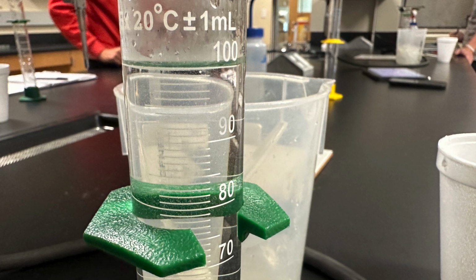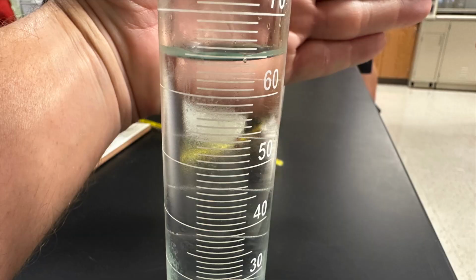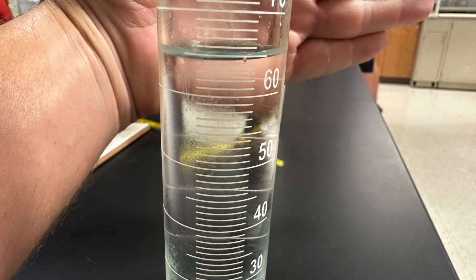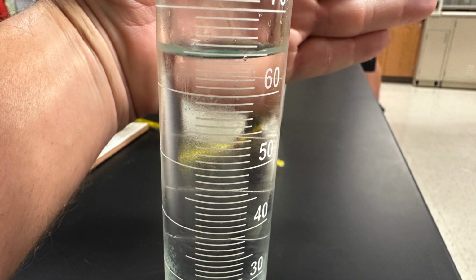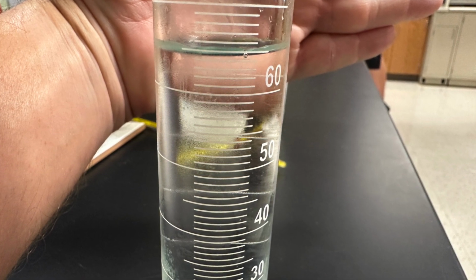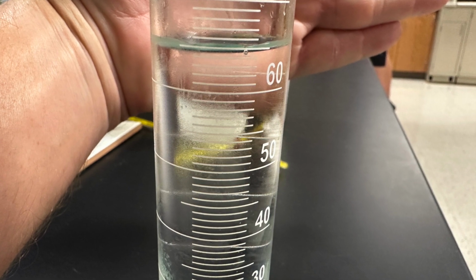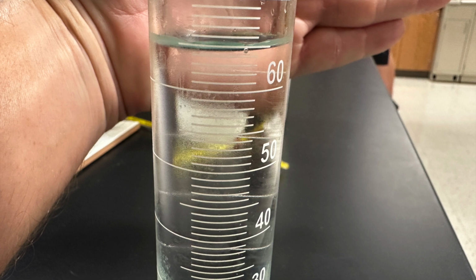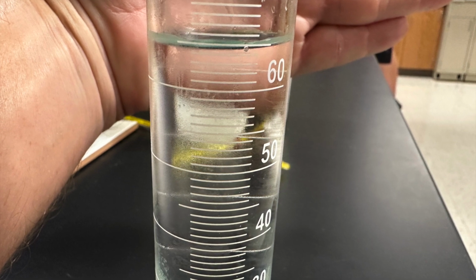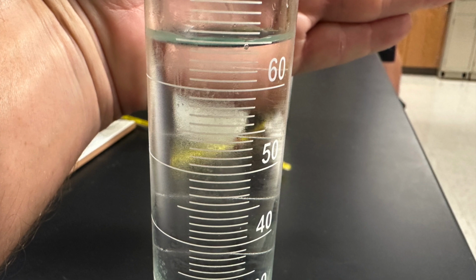You're going to put those data sets into the lab document and then begin to perform the calculations. Those calculations are going to include calculating for energy, calculating for heat of fusion in grams, and heat of fusion in moles. And then don't forget to calculate your percent error, and there are steps to do that at the bottom of the lab document.